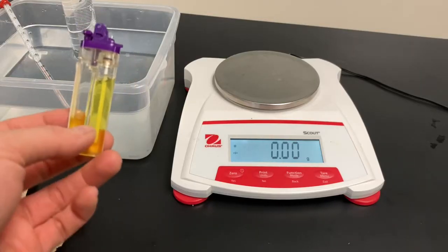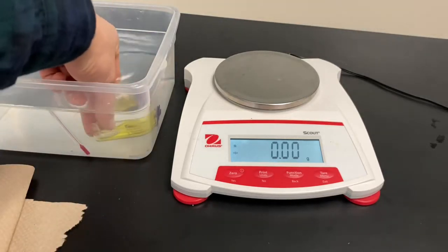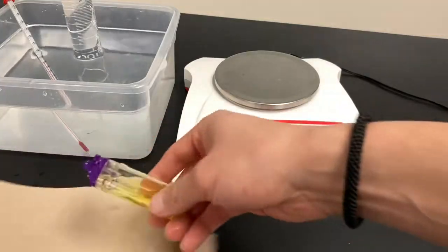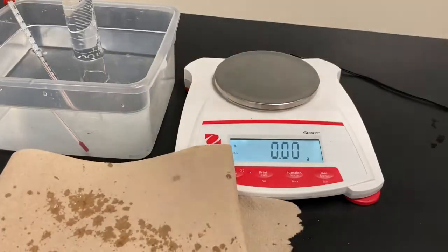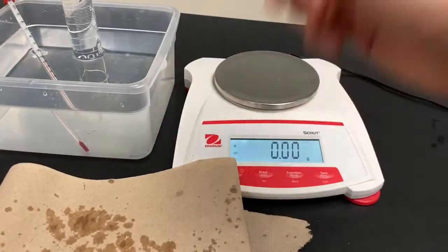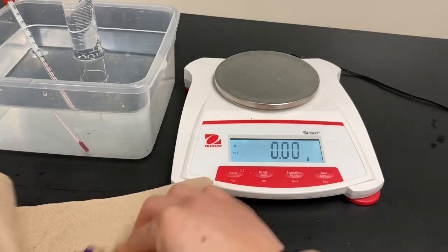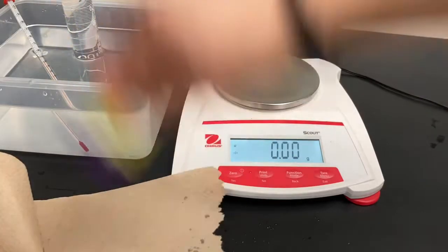The first data I'm going to collect is the initial mass of the lighter. I'm going to dip it in water to replicate the conditions it'll be in later. Once I dip it in water, I want to dry it off as best as I can — give it a good shake — because we're just trying to measure how much butane we're collecting. One possible error is if I have leftover water; then I'd be measuring the water instead of the butane gas that's leaving.